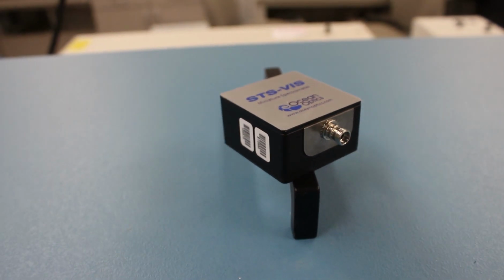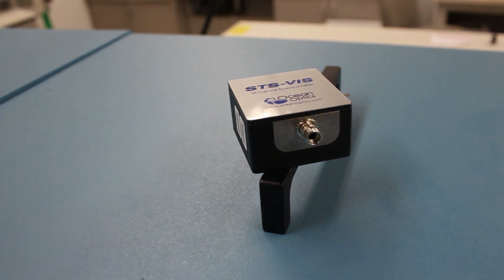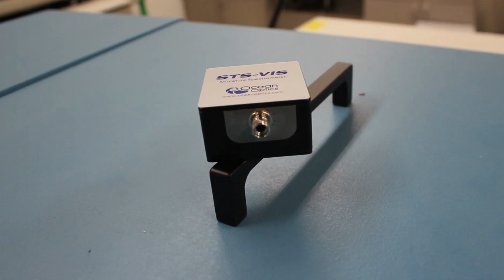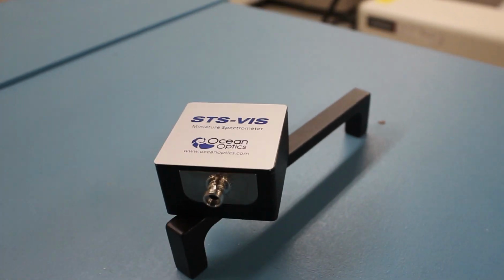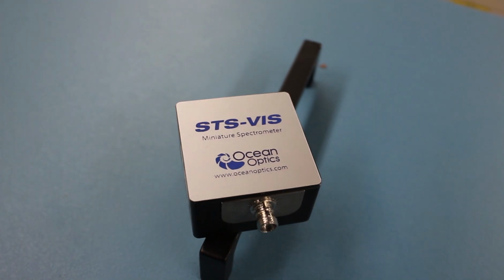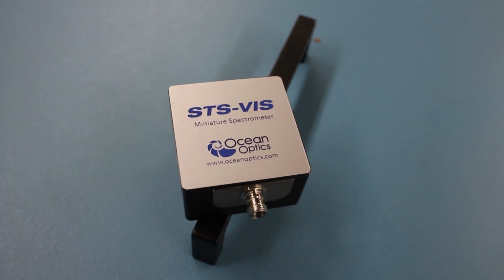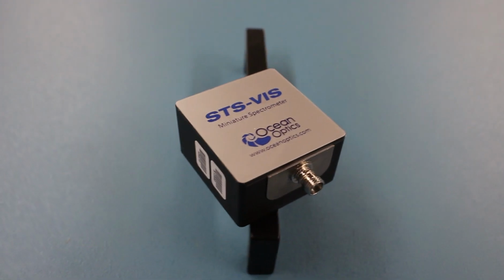A spectrometer is an apparatus used for recording and measuring spectra, especially as a method of analysis. In our experiment, the spectrometer is used to measure the change in the amplitude of a specific wavelength in a spectrum given off by the fluorescence of rhodamine 6G. The spectrometer is used in conjunction with OceanView software, which compiles the data gathered by the spectrometer and outputs useful values of wavelength intensity, which can be compared with change in temperature.